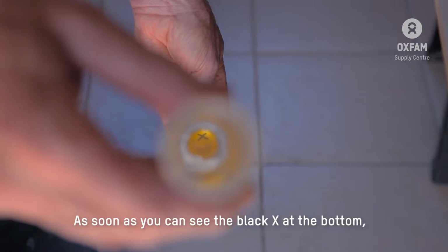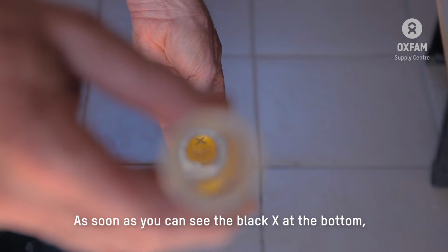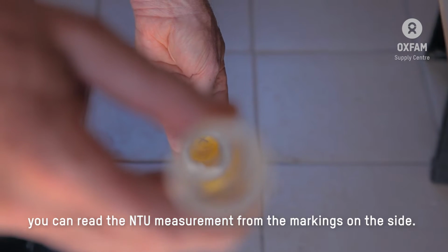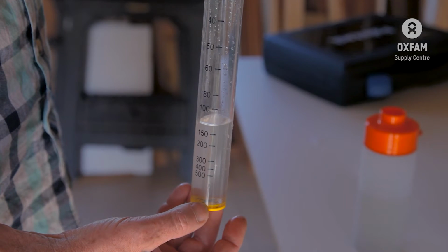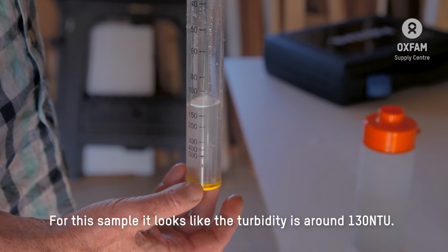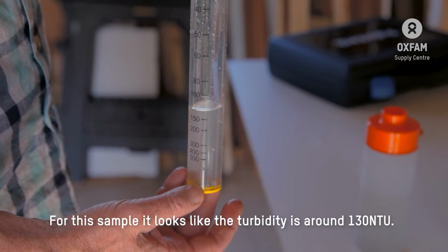As soon as you can see the black X at the bottom, you can read the NTU measurement from the markings on the side. And that's it. For this sample, it looks like the turbidity is around 130 NTU.